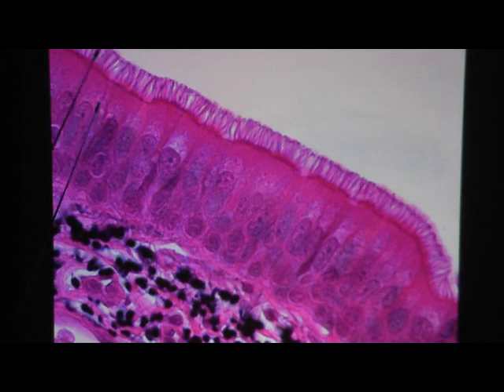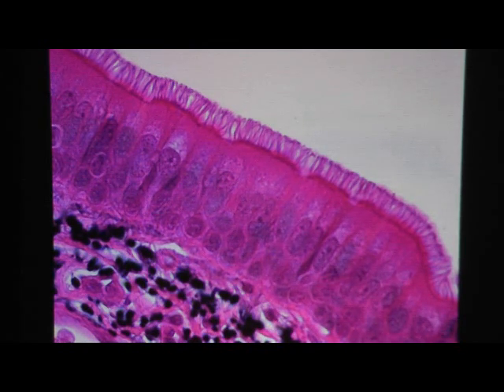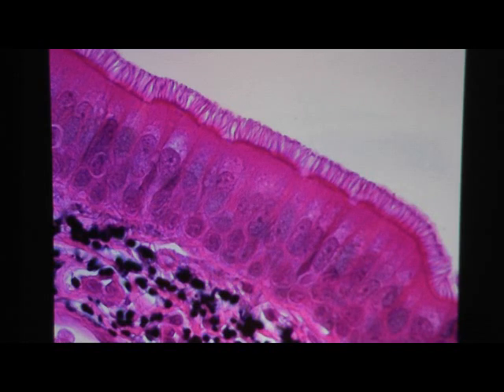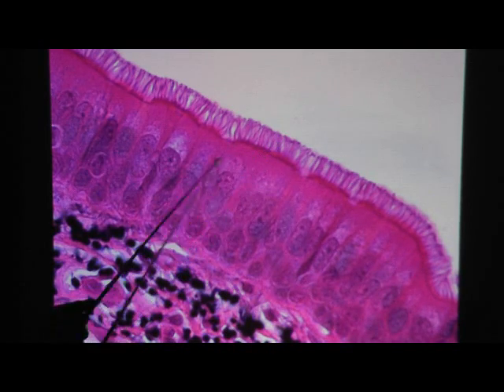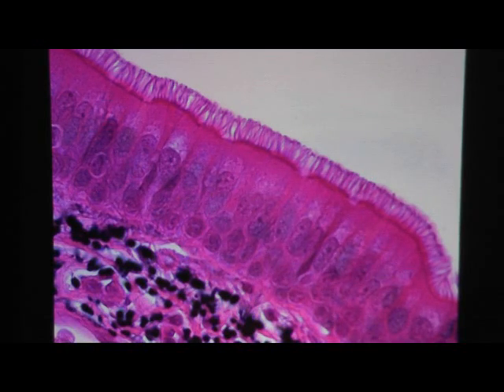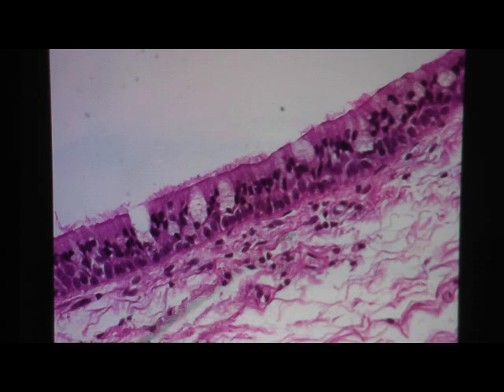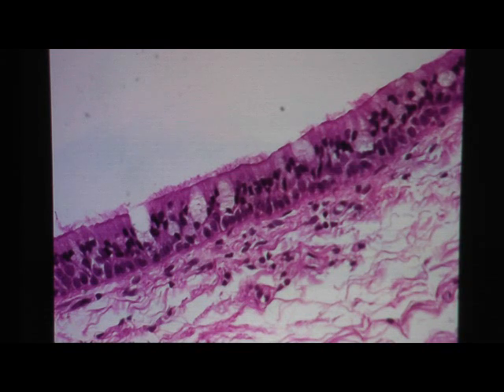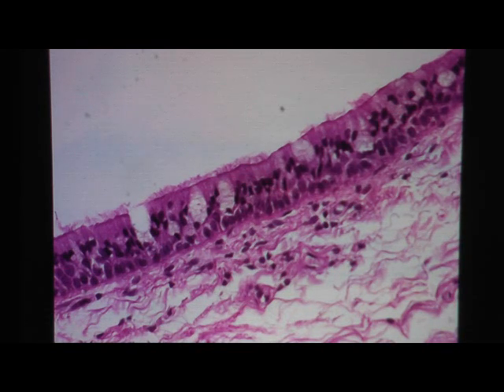This is a great example — you can actually see the strands of cilia coming up at the top at high power compared to the previous low-power slide. Here you clearly see the nuclei, staggered to give the impression of many layers but it's not — so put it all together: ciliated pseudo-stratified columnar epithelium. At low power, the cilia and goblet cells should jump out at you. Altogether, this is ciliated pseudo-stratified columnar epithelium in the trachea and upper airway.